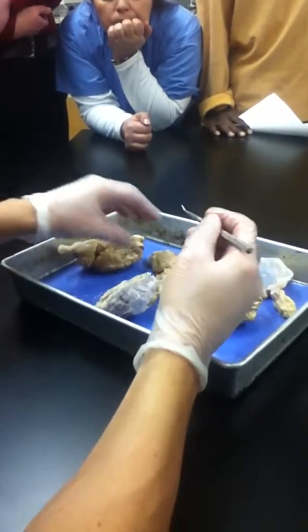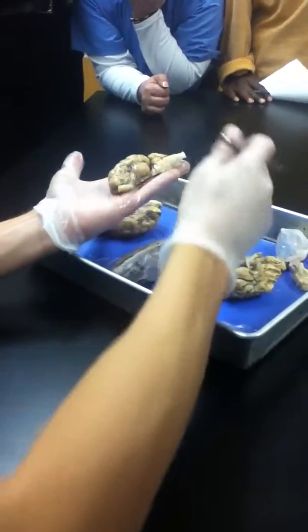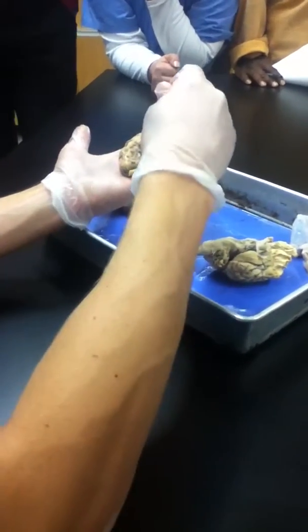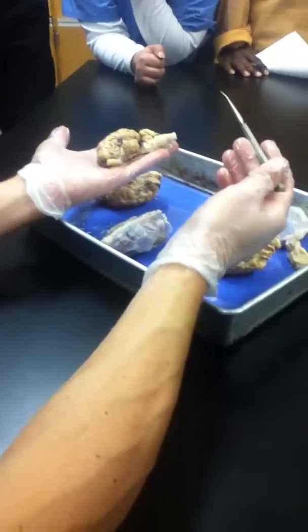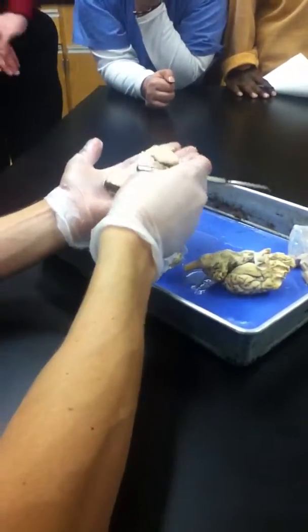The next way to ask structures could be seen from a lateral view, but that's a lot of things we've already seen. So temporal lobe, frontal lobe, now seen from a different perspective. The fissure and cerebellum just seen from a different perspective. So things we've already talked about, but there could be a pin sitting this way and it's still knowing those same structures. But we get more detail when we flip to this side.